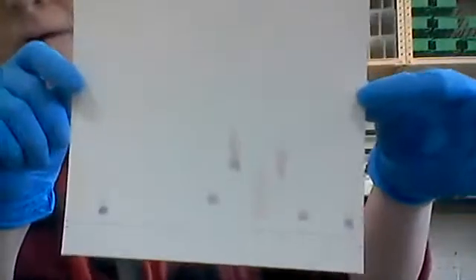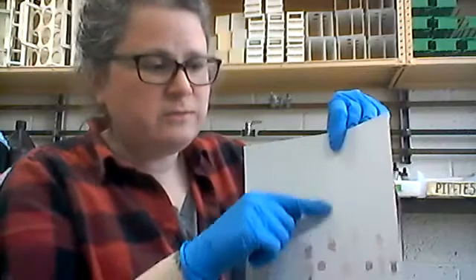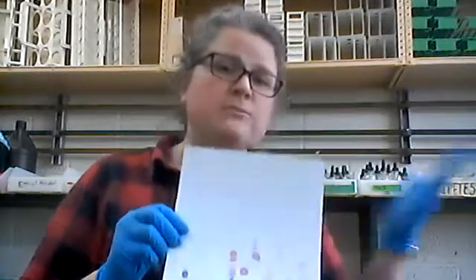The chromatography sheet has now run and hung up to dry. When heated, a lot of the spots show up much better, so I took a hair dryer and blew on it to get it hot. After heating you can see a lot more spots have come out. I'll take a photo to post, and I'll give you measurements along the side. The ratio of how far a spot has moved to how far the entire solvent front has moved gives you the RF value — the retention factor — which is characteristic for different amino acids. You can use results from this and the previous test to fill in all the data tables in your lab manual and answer those questions.